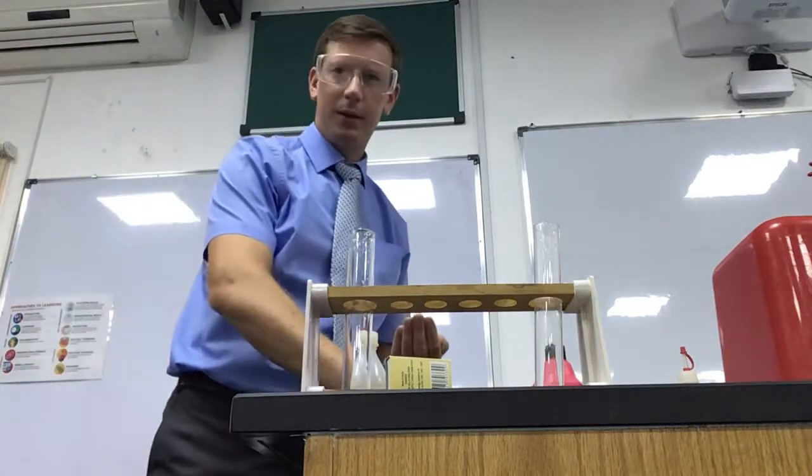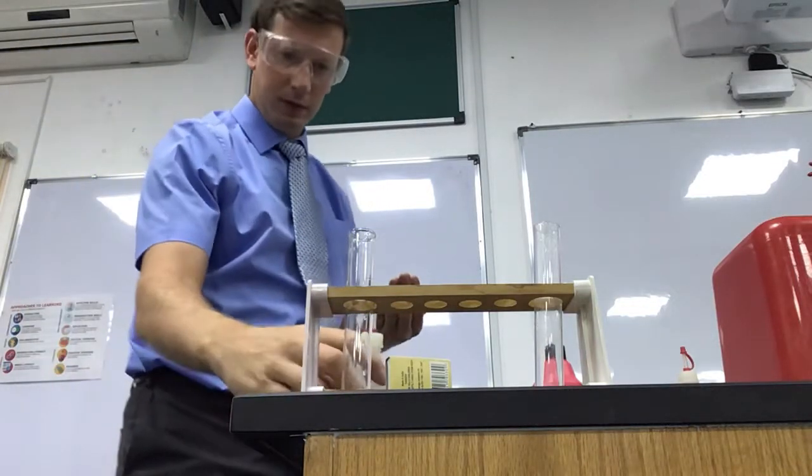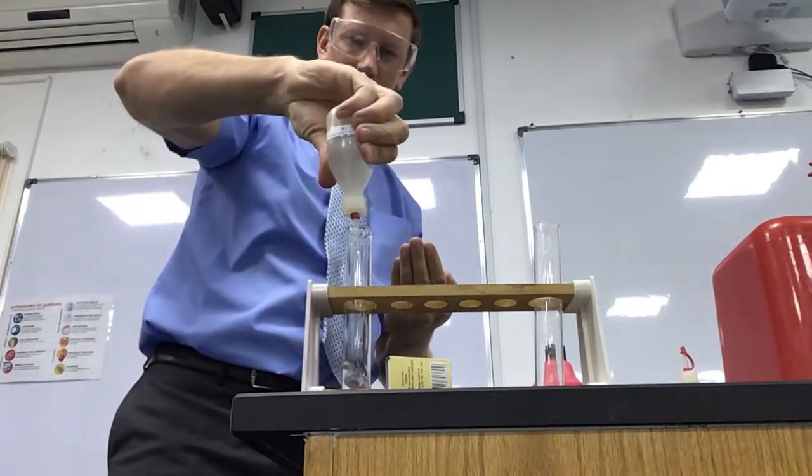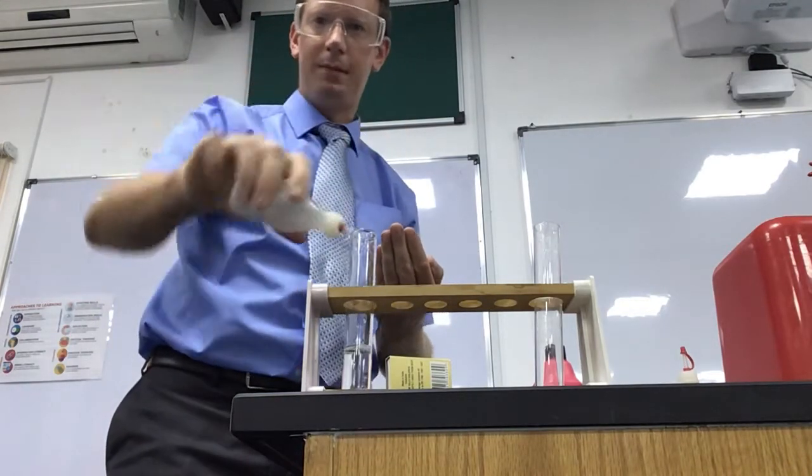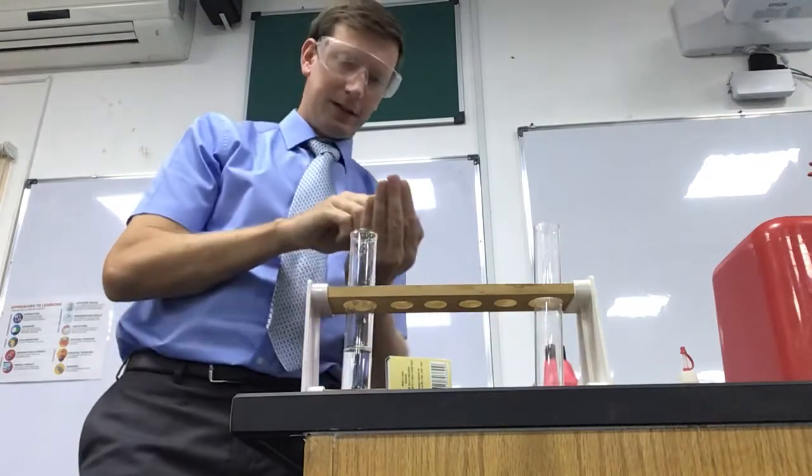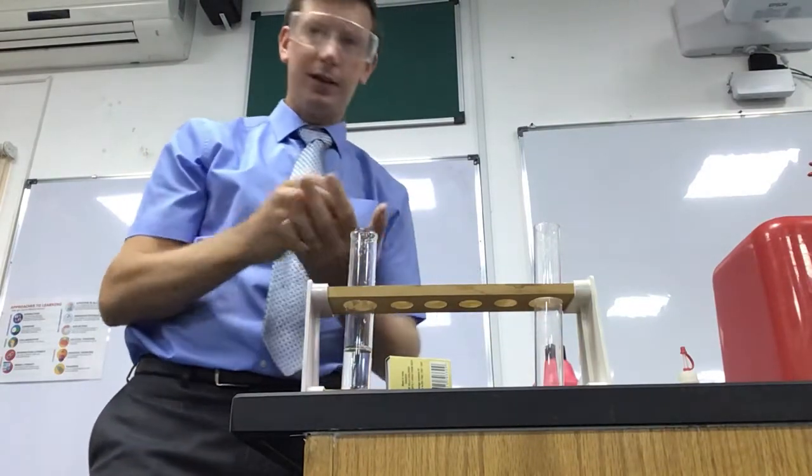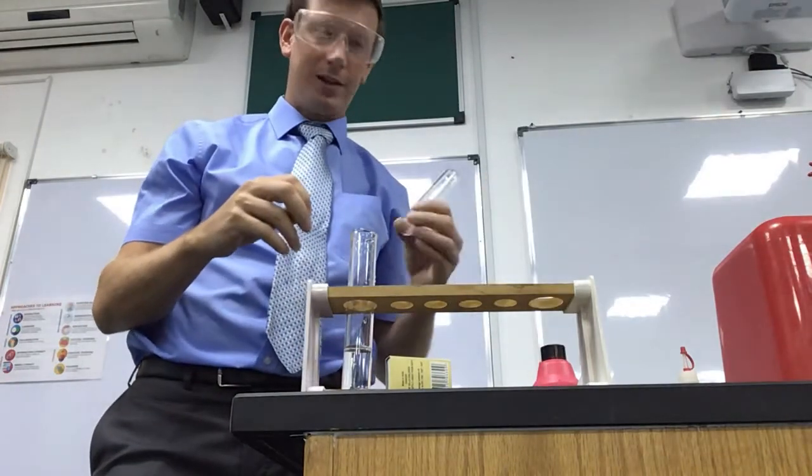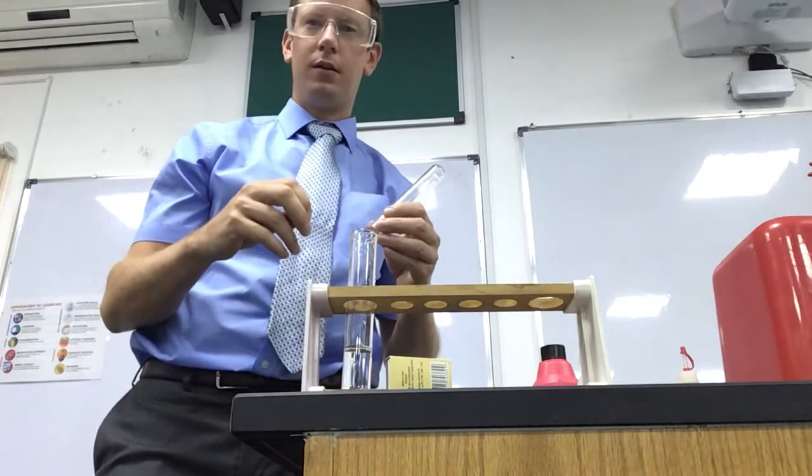In this video I'm going to react hydrochloric acid with some magnesium. That should create magnesium chloride and release hydrogen, and then we can test the hydrogen with the squeaky pop test. I can see it bubbling away.